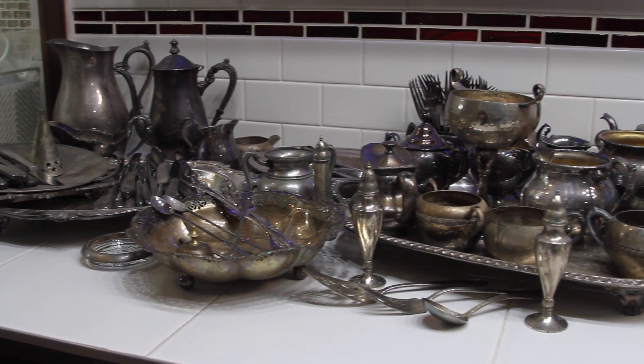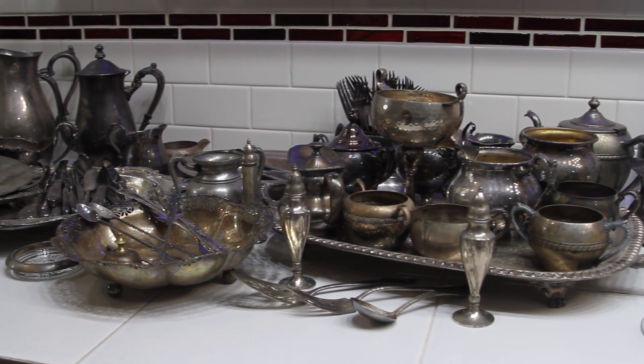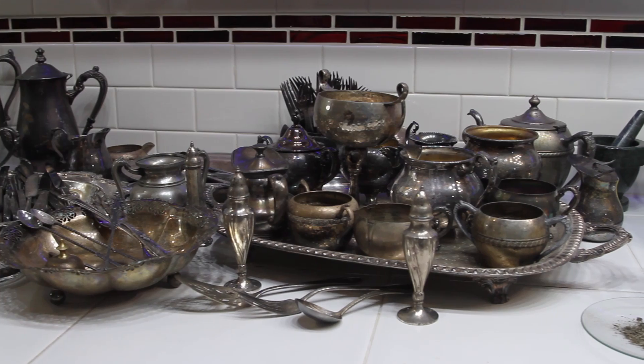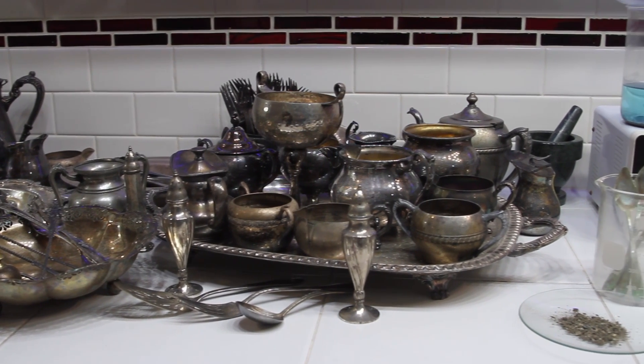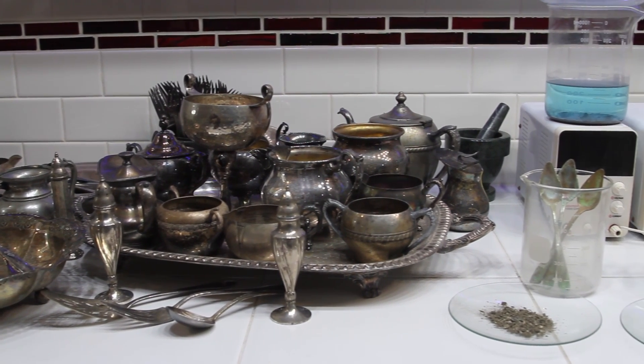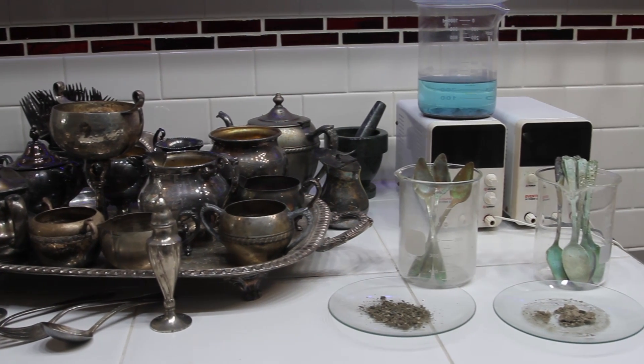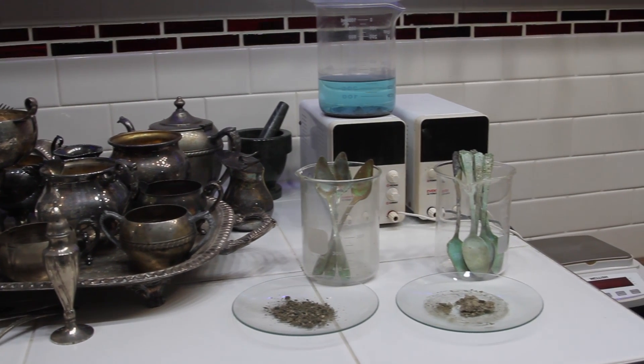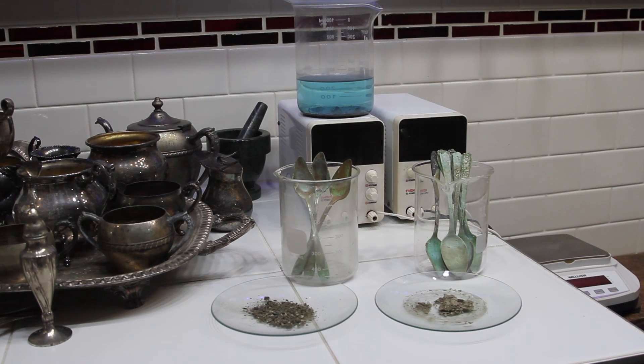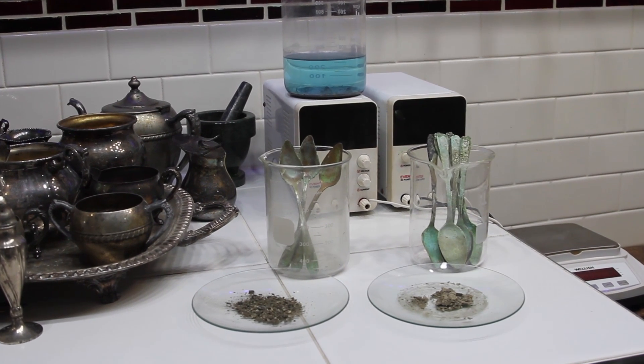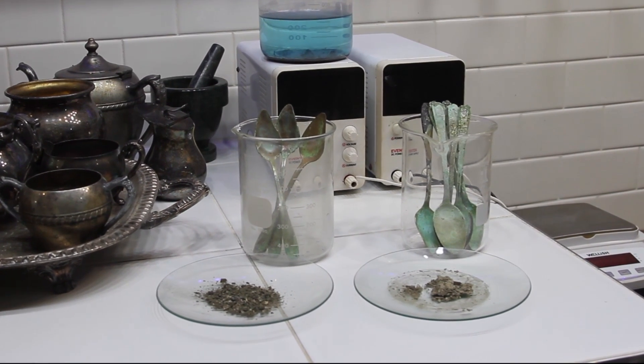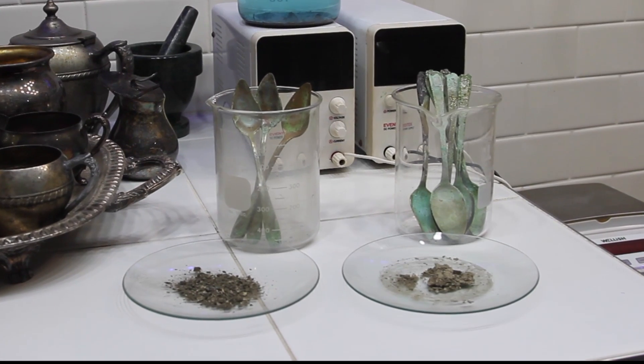In this one I'll show you one technique for removing silver from silver-plated scrap, which is pretty easy to find. I got all this silver here for less than $25. We're also going to test the electrolyte solution. I have a hydrochloric acid solution I want to use and see what kind of results we get. Also keep track of how much silver we're getting off of some of these items. Thanks for tuning in and let's get started.